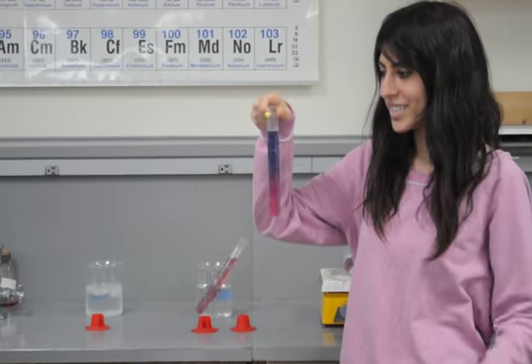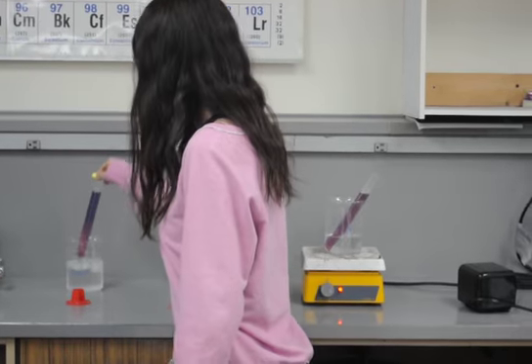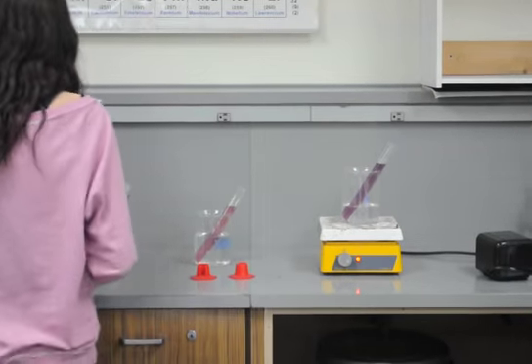That's why you have the different colors. Set that down. And now, Edgar, would you pull out that other tube? The hot one? Yeah, the hot one.